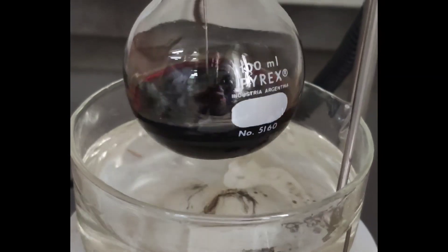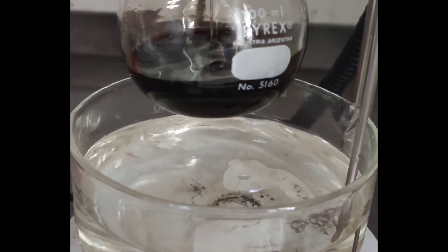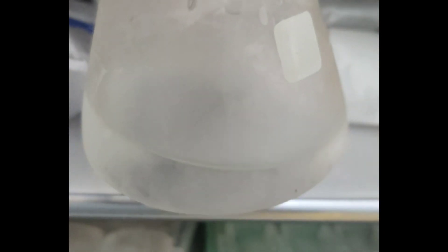We remove the reaction that now looks much more red from the heat. We remove the brine solution from the freezer. It's ice cold but not frozen.